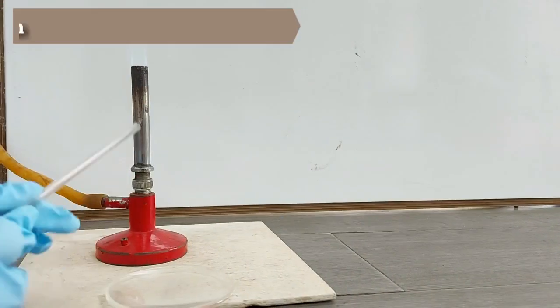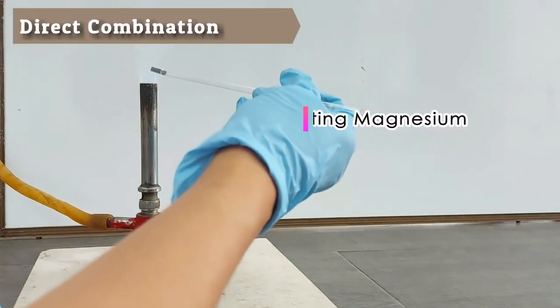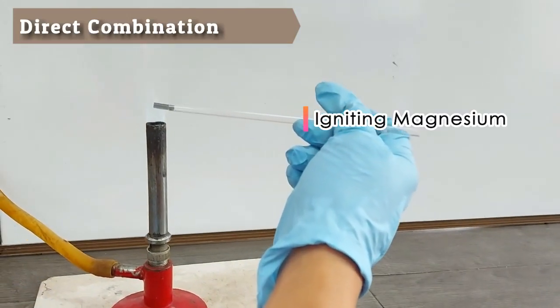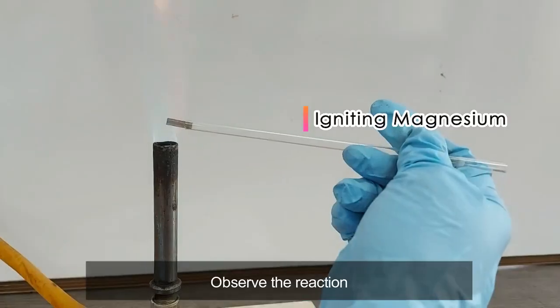Direct combination. Place a piece of magnesium ribbon on the tip of glass tubing and ignite it. Observe the reaction.